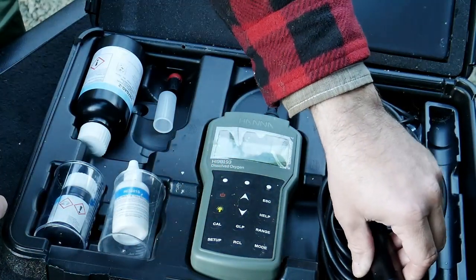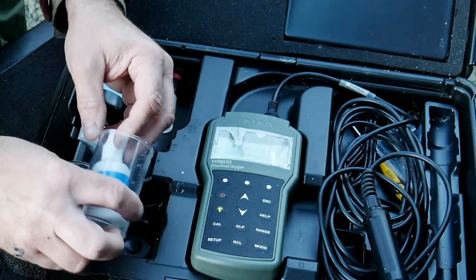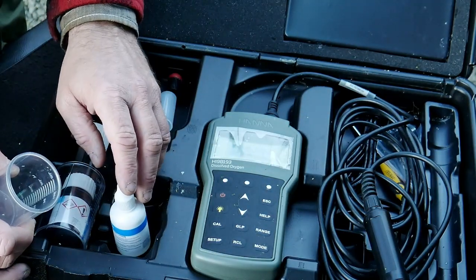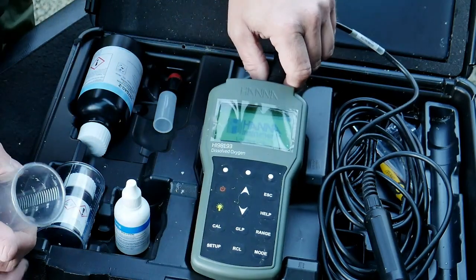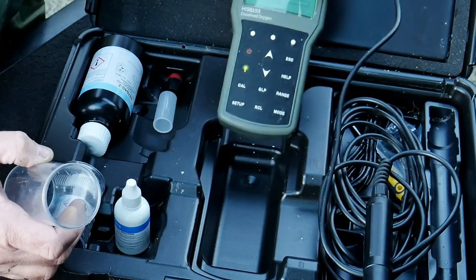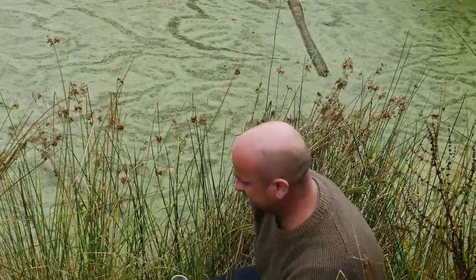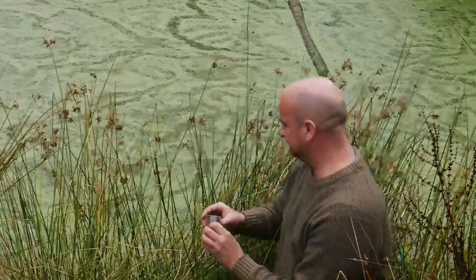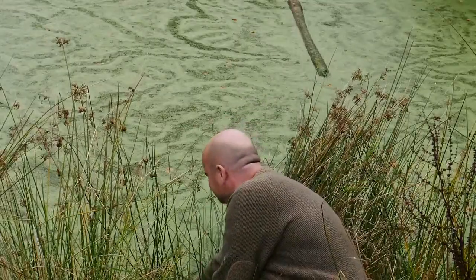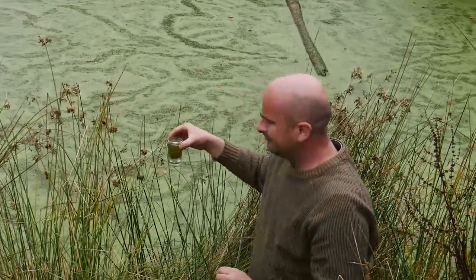In this first video, I wanted to show how I go about measuring the single most important indicator of water quality, that is dissolved oxygen, often just referred to as DO. Using the handy plastic container that comes with the meter, I will carefully take a sample of water from a number of locations around the pool.